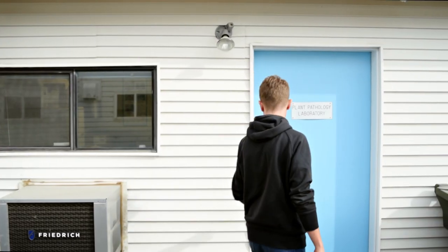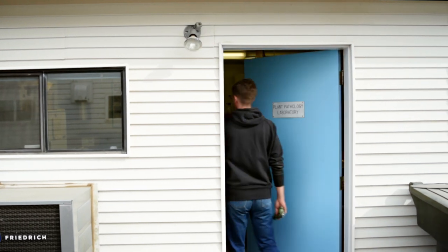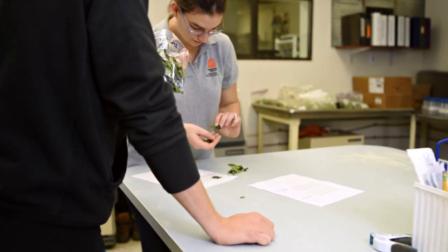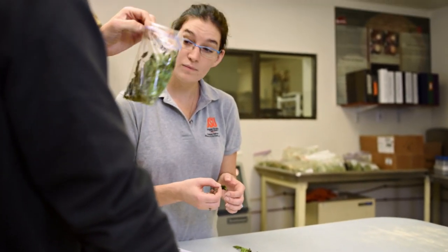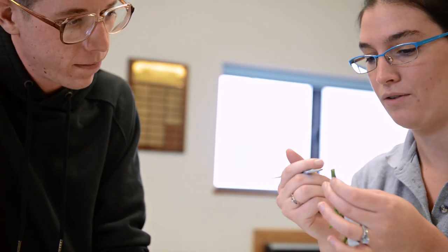When the clients come into the lab we look through their samples and use any kind of symptoms on the plants themselves to help us diagnose, as well as getting as much information as possible from the grower.